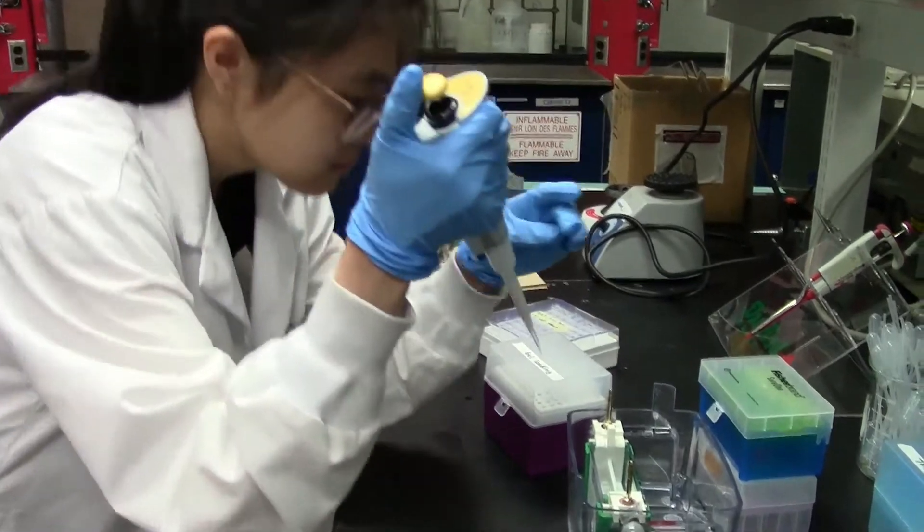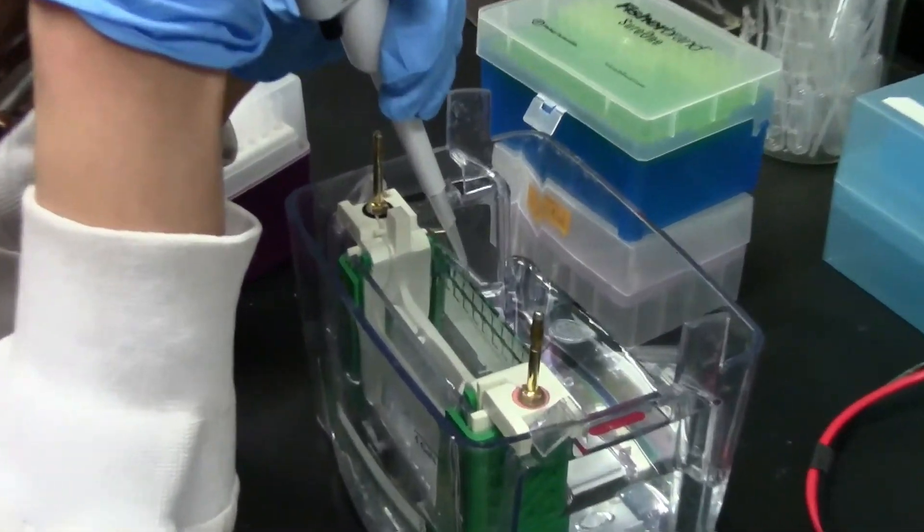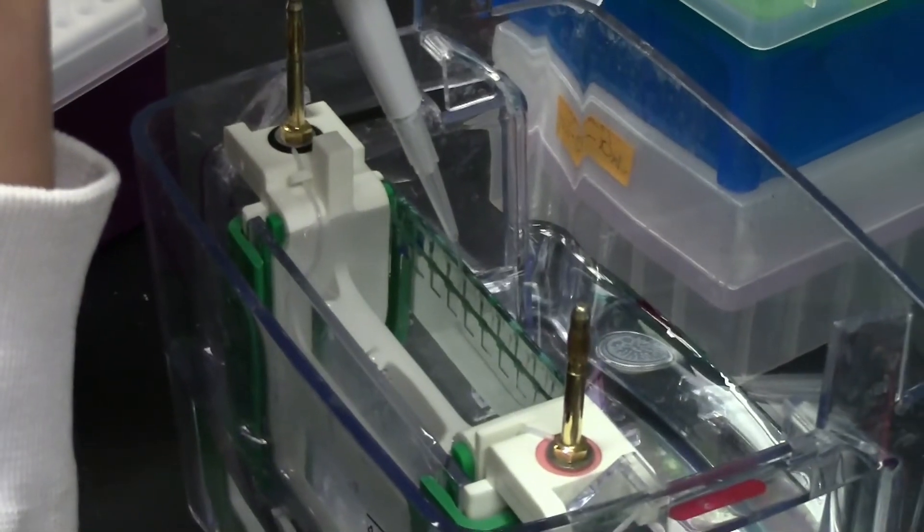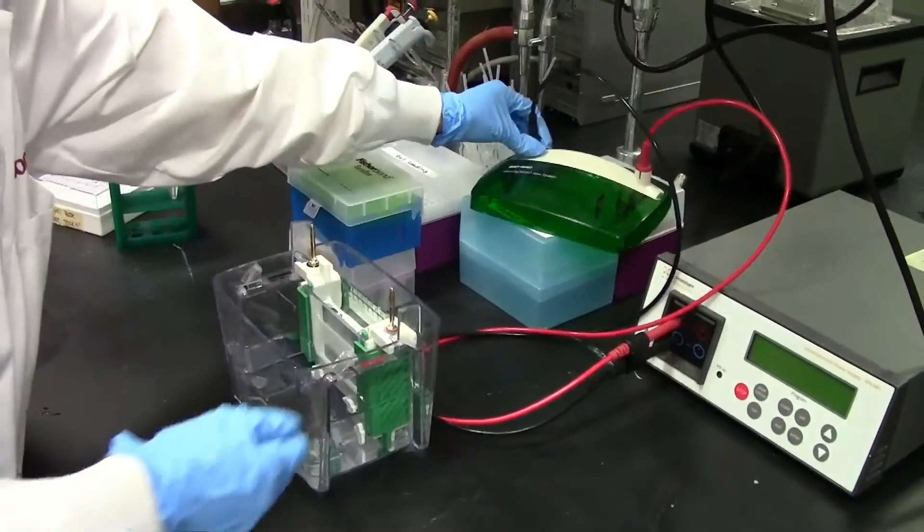All samples should undergo one last vortexing and centrifugation step before loading. And when ready to load, you should feel the pipette tip between the two gel plates to ensure you are in fact loading into the well and not the space between the buffer dam and gel plates.